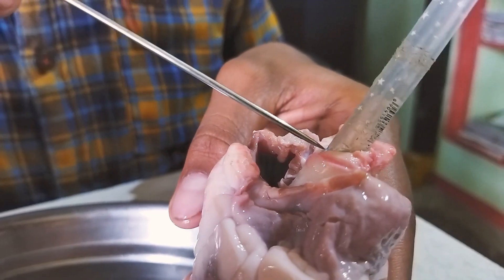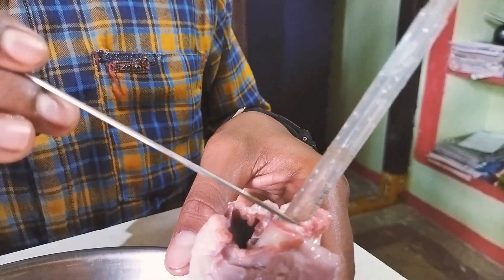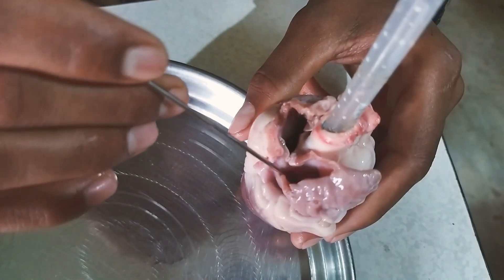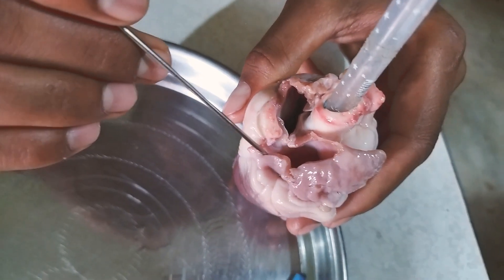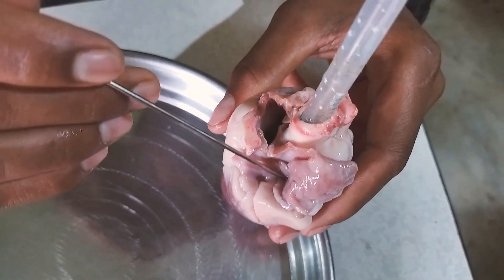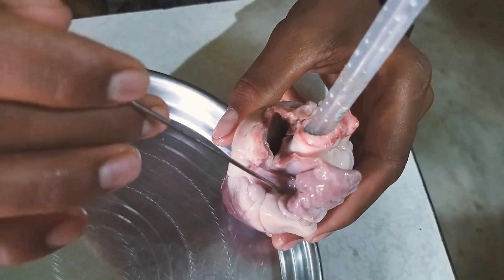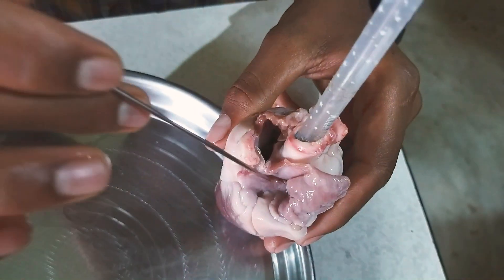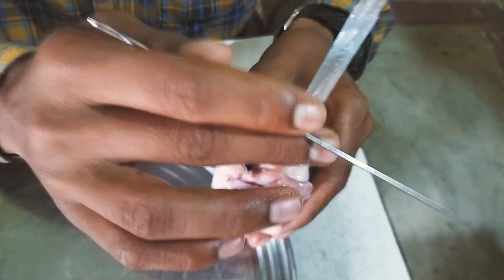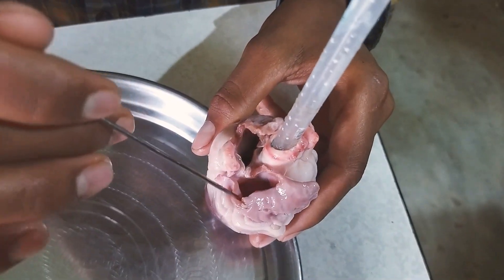In the lungs, the blood is filled with oxygen. Next, the blood comes through the pulmonary vein — this is the pulmonary vein. The pulmonary vein brings the oxygenated blood from the lungs to the heart. In the lungs the blood is filled with oxygen, and the blood comes through the pulmonary vein.